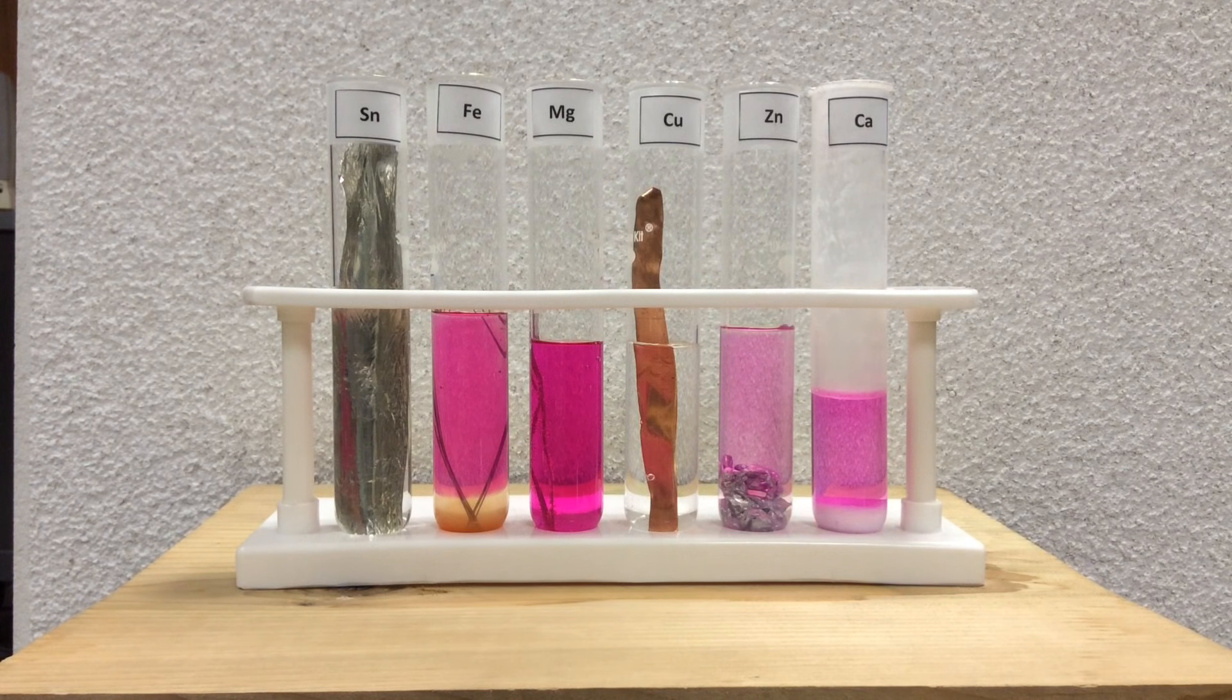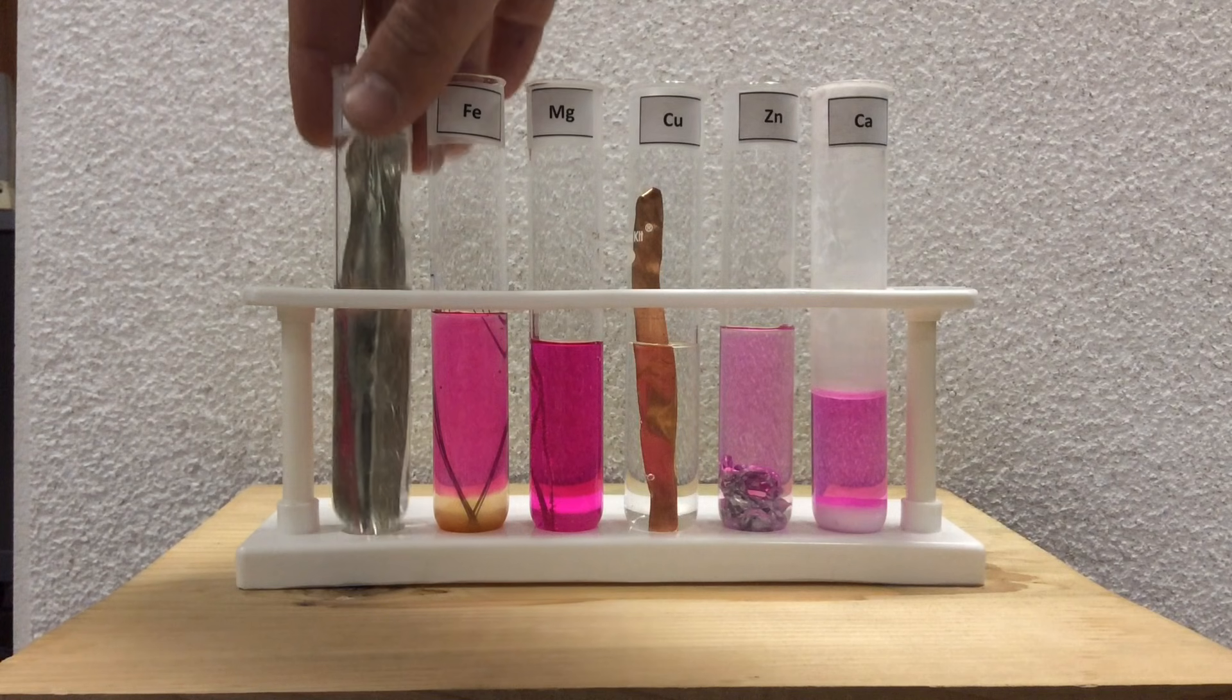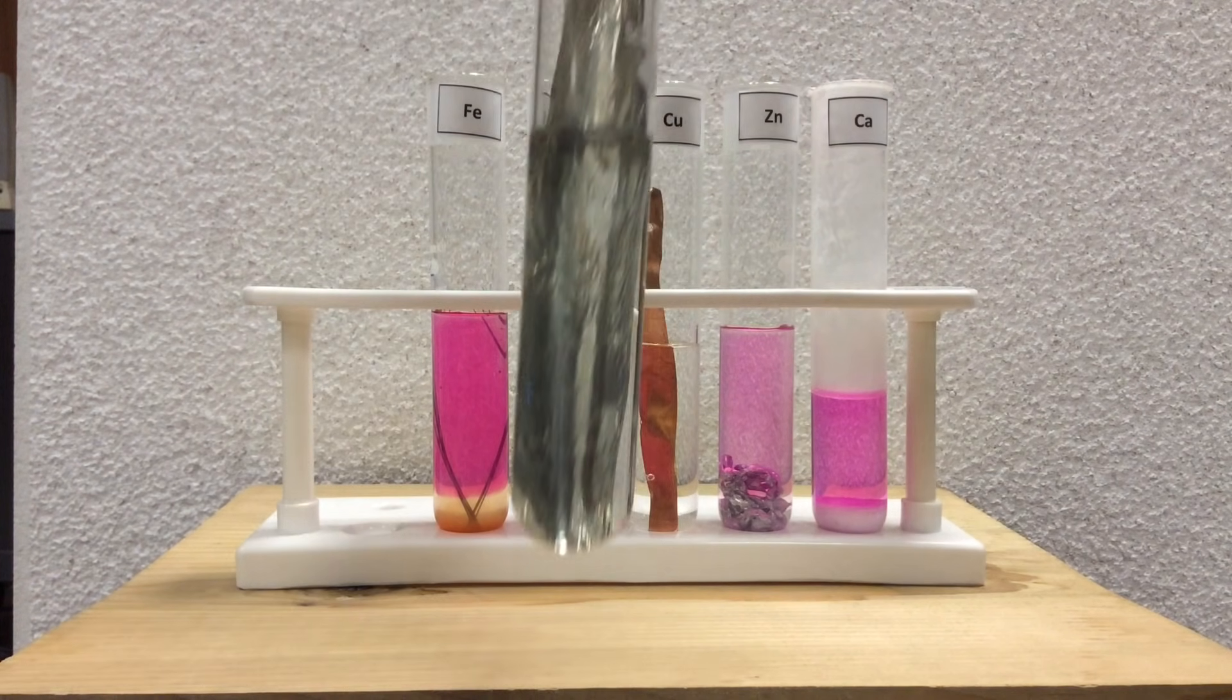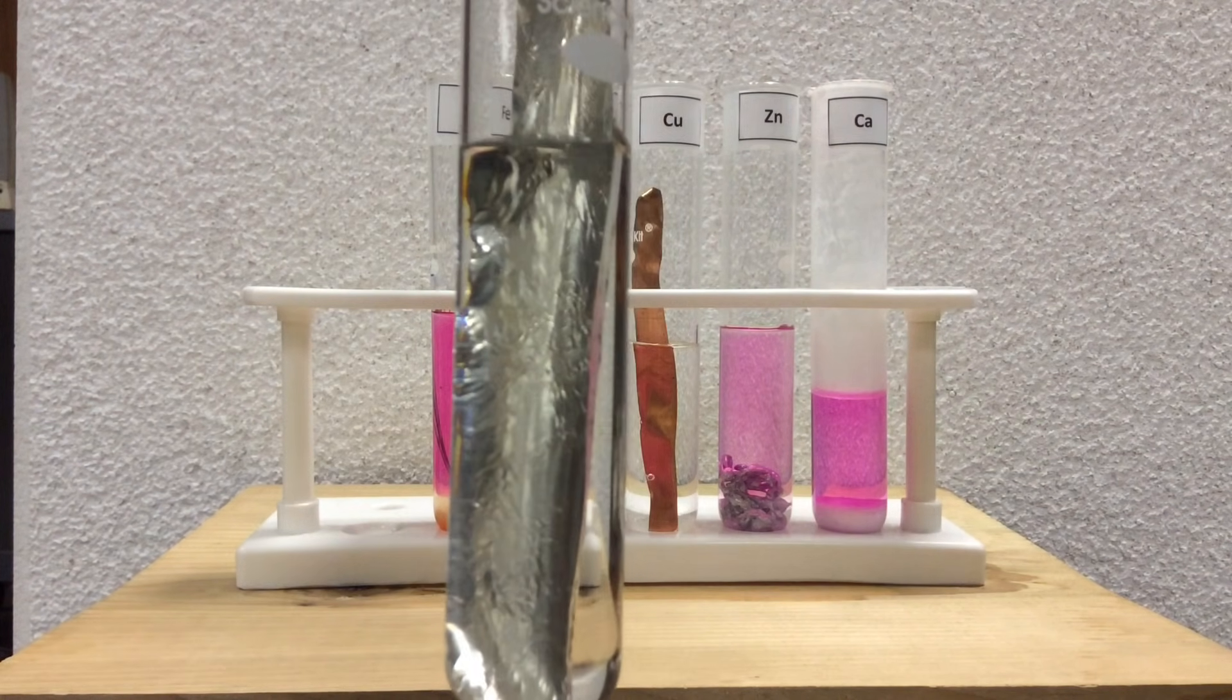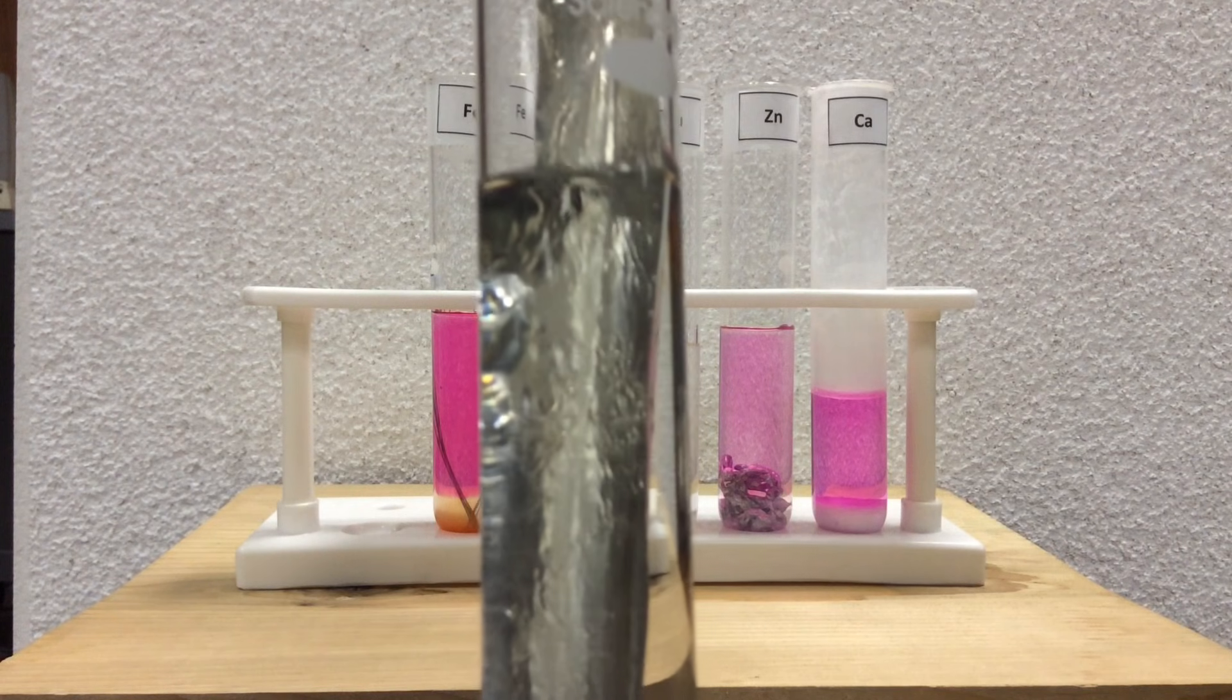Calcium probably would be, but some of it might have pushed out the top. So, now, a day later, you can see clearly that there is some reactivity. And, of course, the tin here does not show any bubbles or any color.